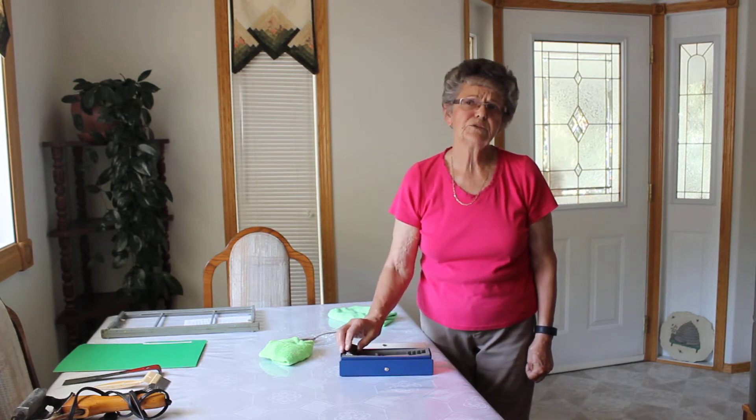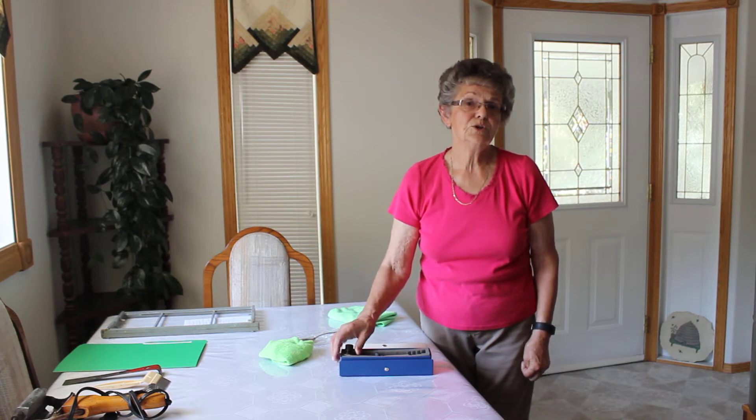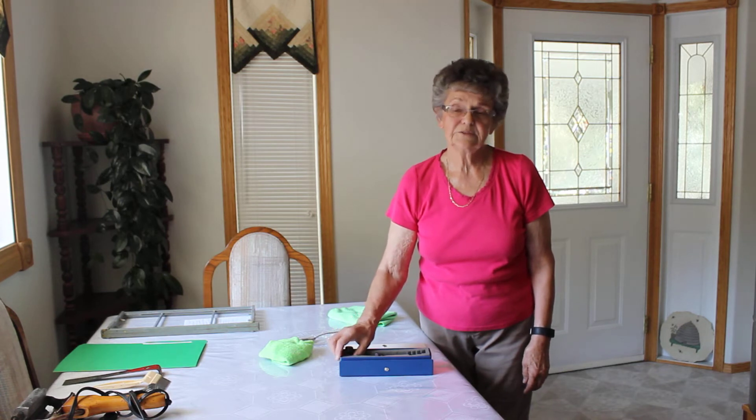This year is not too much of a problem, but you do want — especially at the end of the year when you have to take all your honey out — you want to be sure that it isn't over 18%. If it is, then it may ferment. It will be more like a wine than a honey, and of course it is not usable.